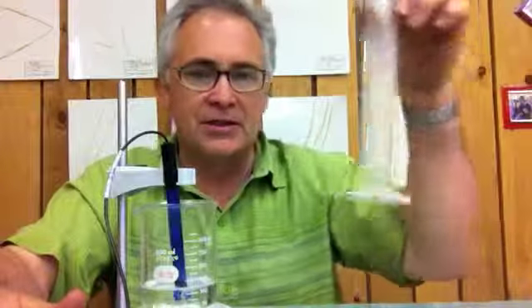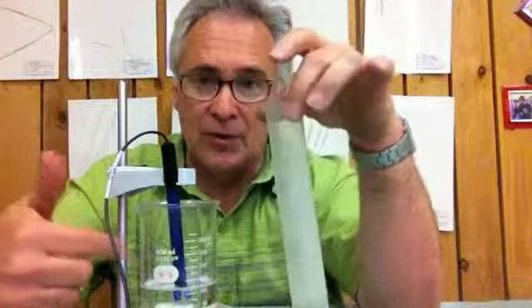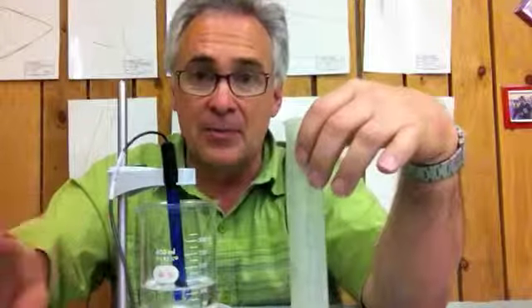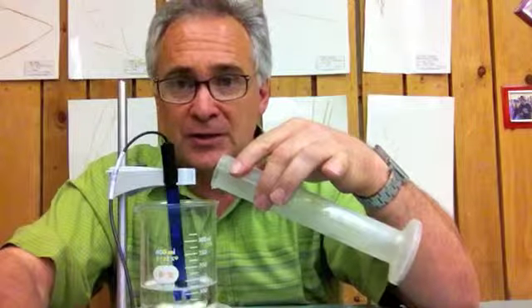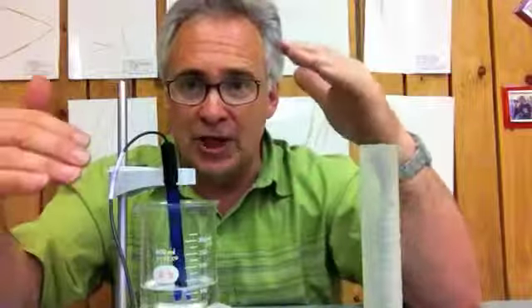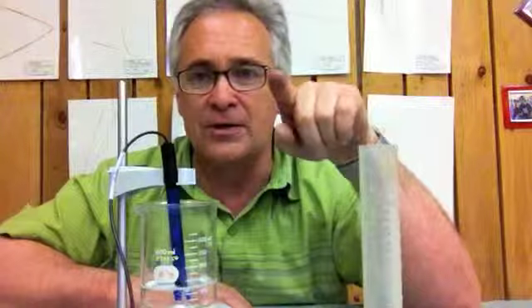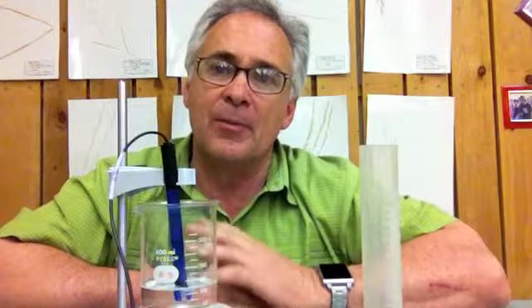So, again, you have your stir plate, you have your pH probe, you have your magnet, you're going to have 100 mLs of club soda, and you're going to have 10 cc's or 10 mLs of vinegar. You're going to let this run for 30 seconds, keep it running, don't turn it off, and then you're going to pour this after that 30 seconds. Then wait 10 seconds, get the reading and see how much it changes, and then hit stop. So follow the directions as they are in the data logger. You should be able to come up with some pretty good data at the end of this.